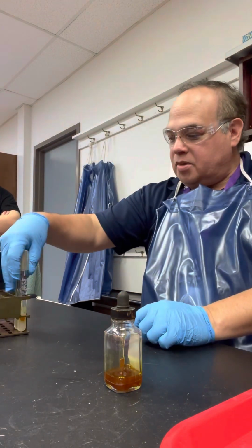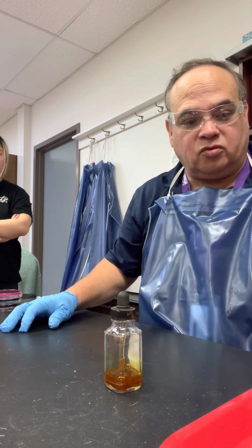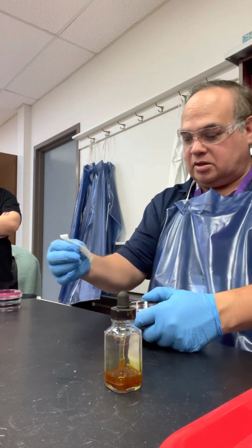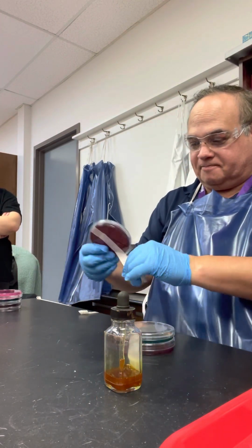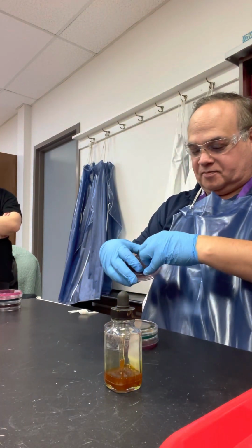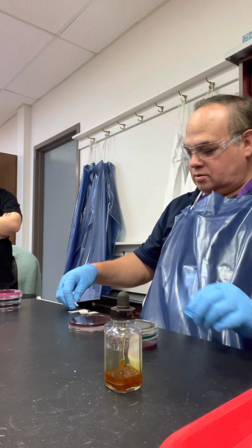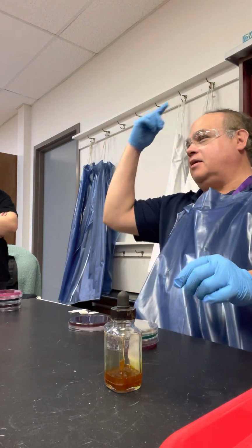All right. Now, the most beautiful test are these. So we did these, and how much tape do you need? Good Lord. What group is that? I'm not sure. I think that's not a group that likes a lot of tape. Is it four? It's three. No, it's four. I did not take that. It was probably Adian. He's not here. We're just going to blame it on him.